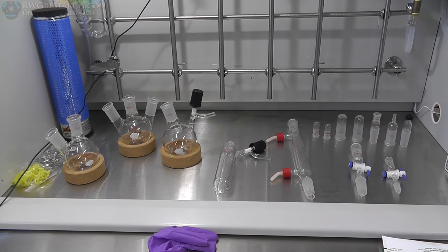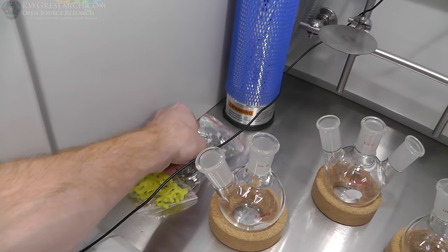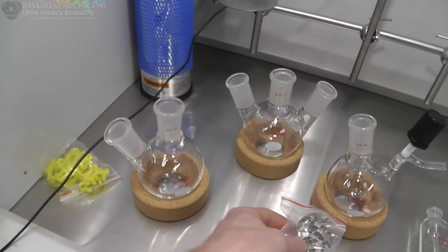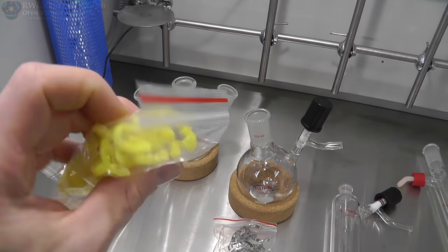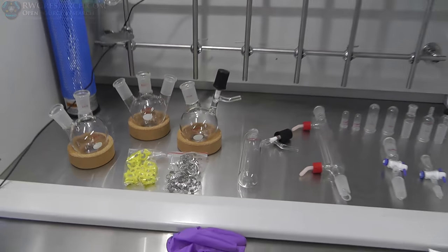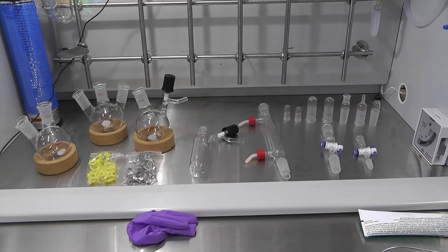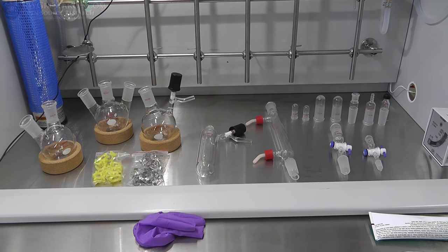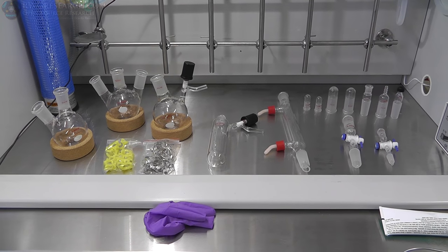Now some people are going to say, how do these things stay in place? They make these little clips. These happen to be metal ones. These happen to be plastic ones. And I'll put one of these together so you can see how these work. But this actually holds everything from just falling apart. So, yeah, those are some of the basic components. There's hundreds and hundreds and hundreds more. But this is what I have. There's also more, but this is the basics that I have.